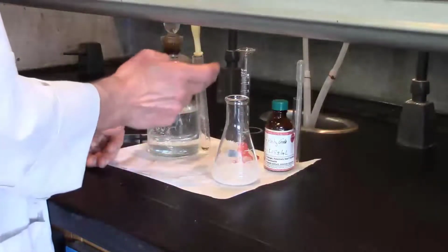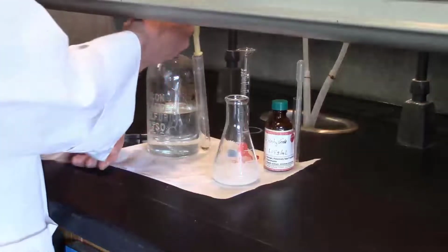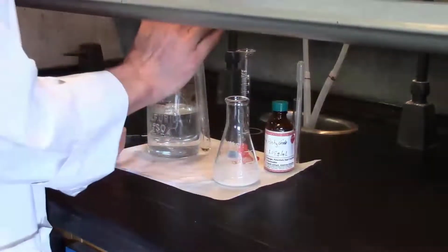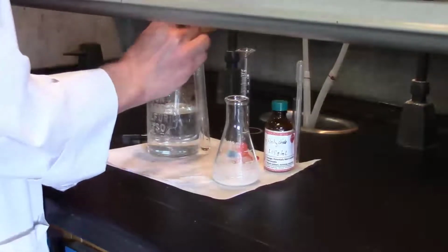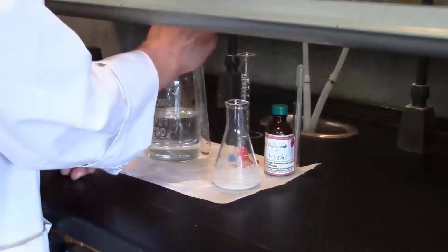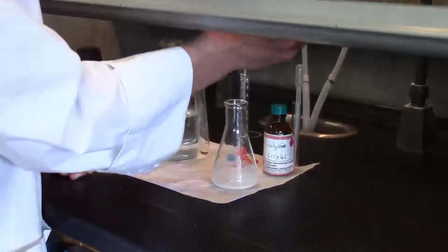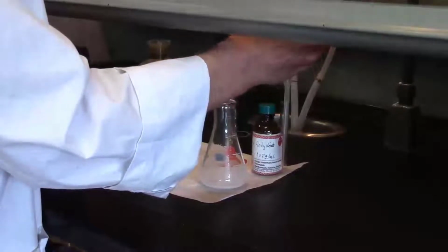So I have here a Pasteur pipette from which I will collect the 5 drops. So you can see what I'm going to do is lift the lid this way. I don't want to really put down this lid anywhere, so I'm holding it between my fingers. I'm going to reach in and suck up some of the concentrated sulfuric acid. Now it's a very viscous liquid, so you won't get very much when you suck up, but you don't need very much, just 5 drops.